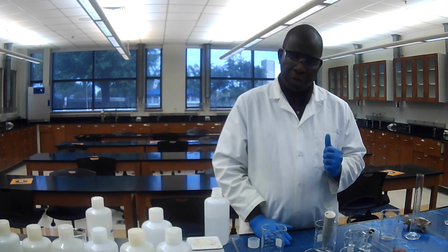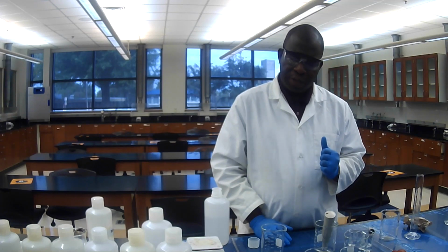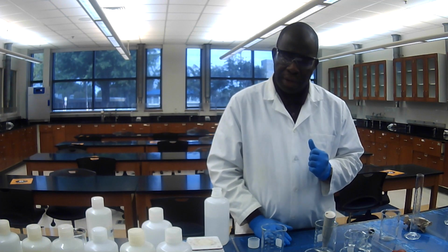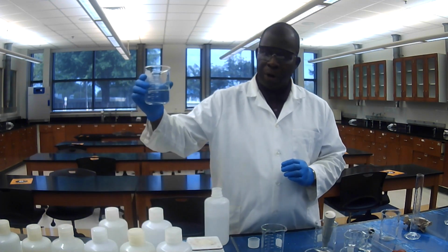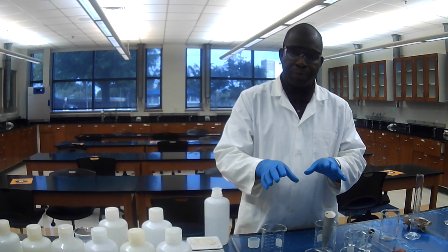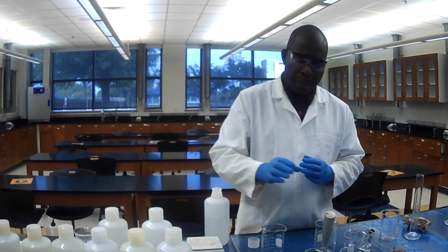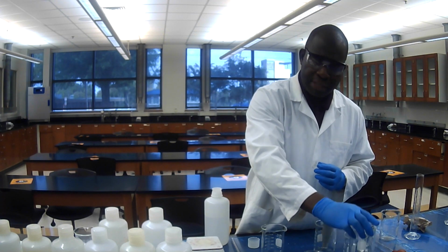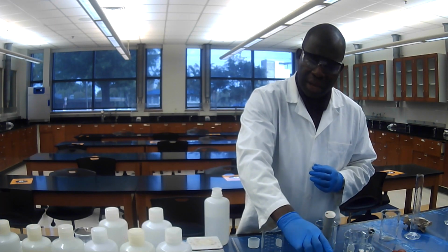Okay, for beaker number 3 and 4, you are going to measure and add 16.1 milliliter of boiled water into each one of them. I have my water here, I already boiled it. I'm not going to perform this part, but I want to tell you what you do to finish up this experiment. You add 16.1 milliliter of the boiled water to beaker number 3 and beaker number 4.